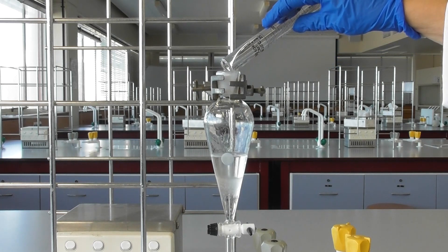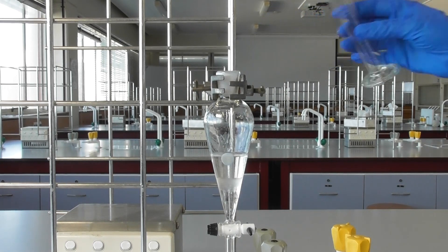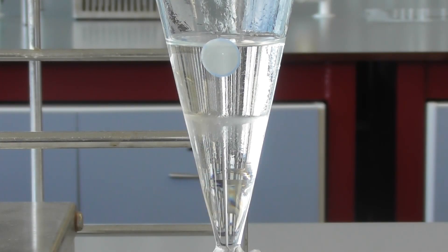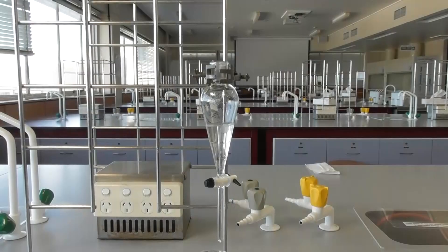Depending on the amount of acid present, this can be quite a vigorous reaction. Here you can see the bubbles of CO2 formed as the acid is neutralized.